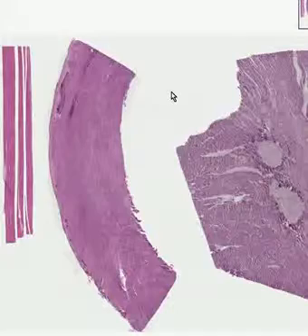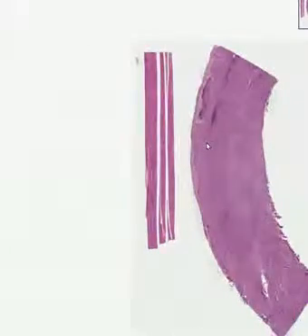In this field, we have all three kinds of muscle. Looking at the first one on the left, you can quickly see that these fibers are clearly striated. In addition, they are arranged very longitudinally, like logs on a neatly stacked fireplace. The nuclei are all out at the periphery, so this is classical voluntary skeletal striated muscle. If you cut one of these nuclei tangentially with respect to the fiber, it might look like it was in the middle, but that's just a geometric artifact. In true voluntary skeletal striated muscle, the nuclei are all at the periphery.